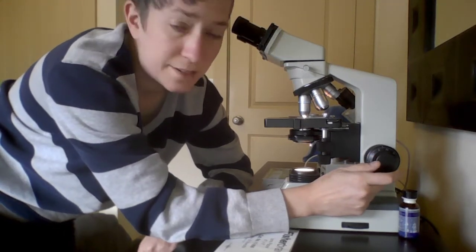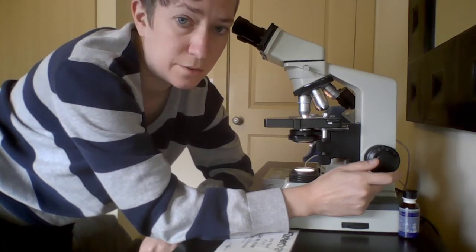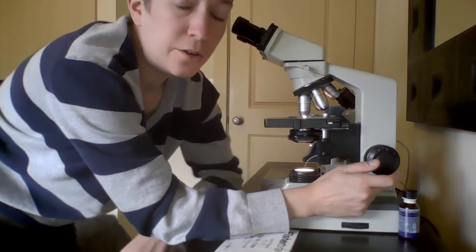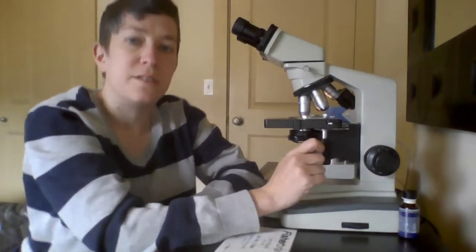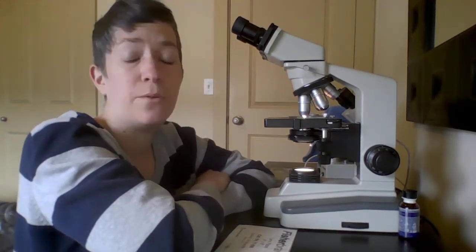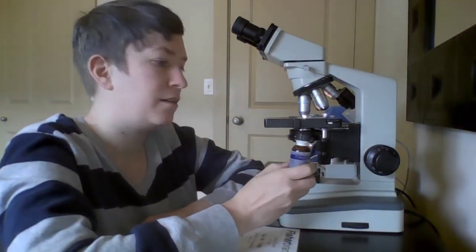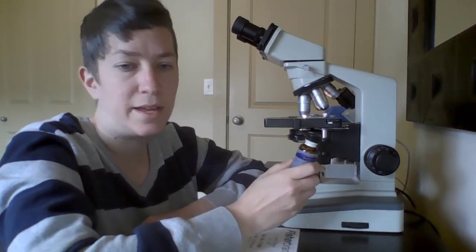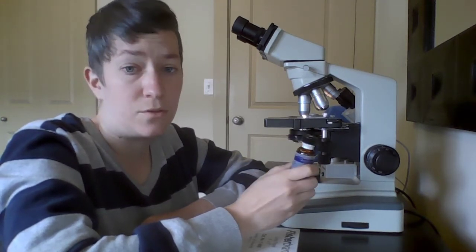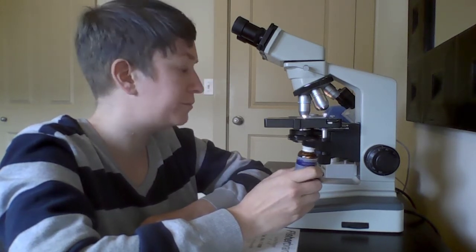And then last would be the oil immersion lens. So mostly when looking at bacteria, we're going to use either the 40 or the 100, which is the oil immersion lens. You need to be absolutely sure that you are seeing the right thing at 40 before you move up to the 100. Because if you aren't, then once you use the oil on the 100, there's going to be a bunch of oil on your lens, and you'll have to clean it all off before you go back to the 40. Because you don't want to get the 40 lens covered in oil.